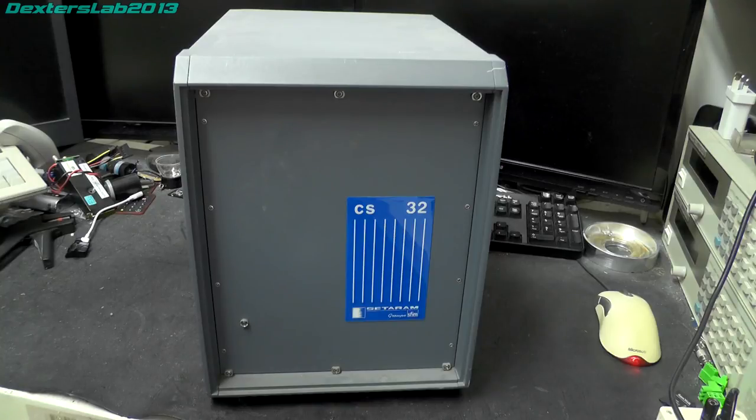So nobody else bid on this. To be honest, it's part of a larger system and it was probably unlikely it would have sold for much anyway without it all being complete and together. So this is actually a Setaram CS32 controller. From what research I have done, it seems to have been part of a thermal analysis system. So there would have been other bits that went along with this.